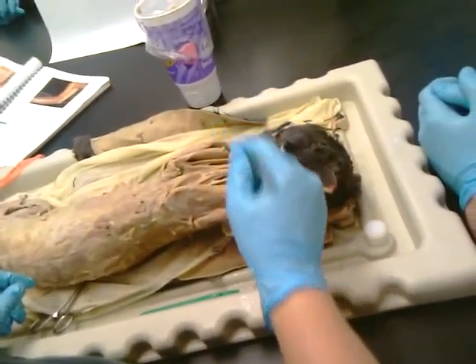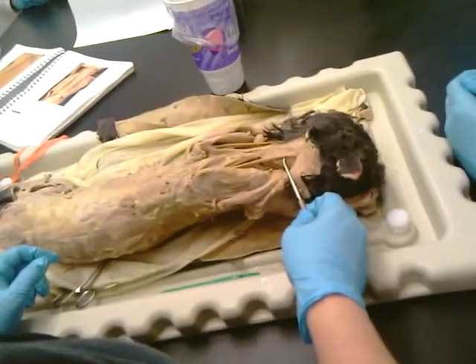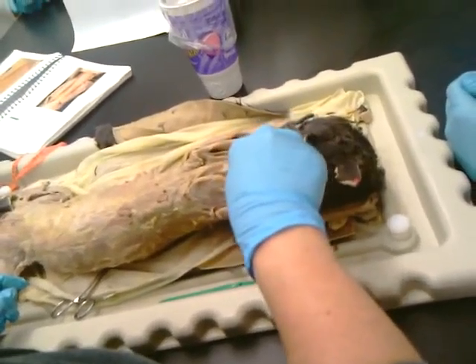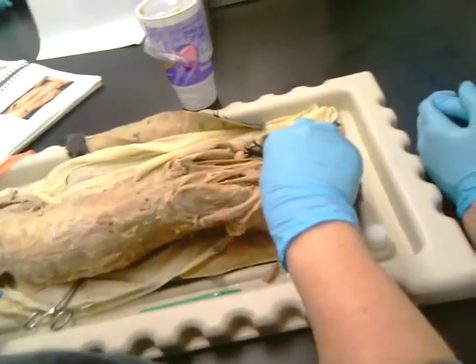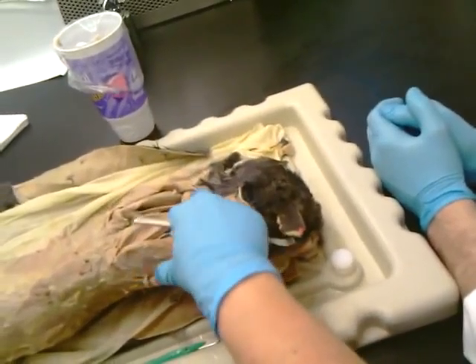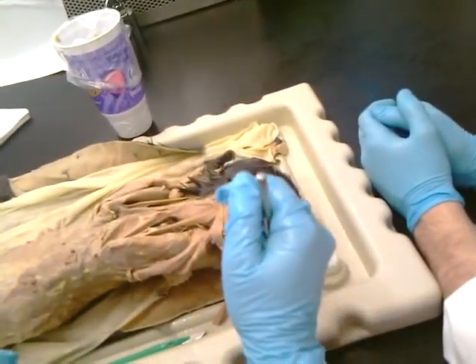What is it, just for curiosity? Here's the rhomboids. Okay, this is called the rhomboides capitis, because it starts on the same origin, but it's going up to the head. Rhomboides capitis. Okay? So here's the rhomboids. And then this guy under here, that's the splenius muscle. And it helps them extend their neck. Okay, this is the other side of the serratus ventralis, right here. It's going to start down here and wrap around the front, in those little finger-like projections.